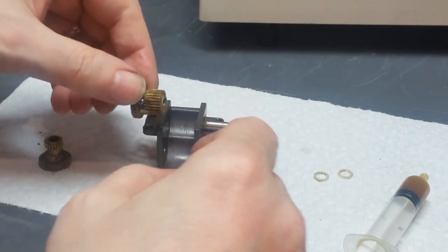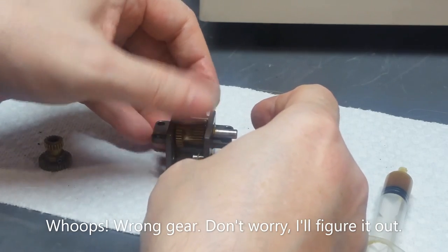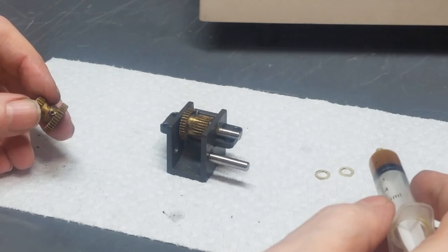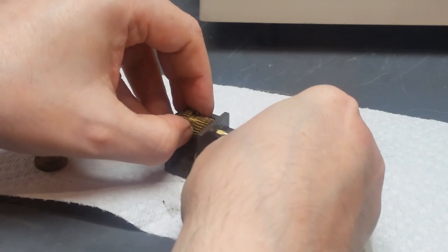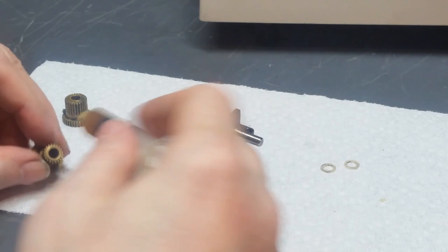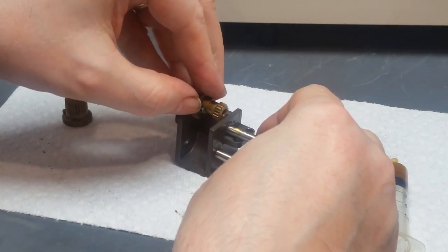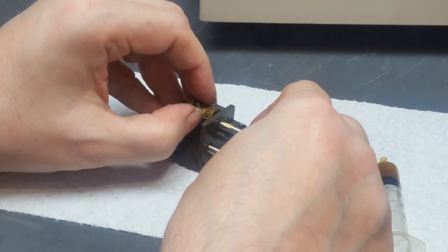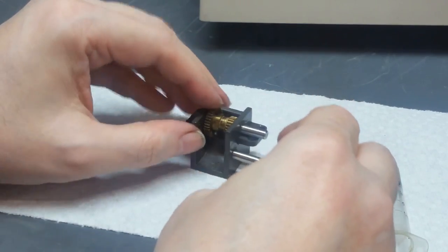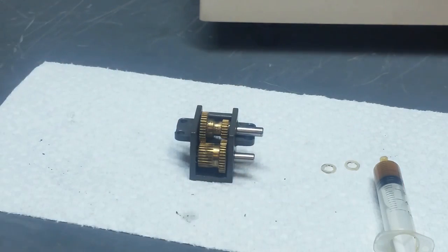Now what I'm going to do is drop it in place, push the shaft in to hold it. Okay, so right now that's not going anywhere. Now I'm going to repeat the same thing with the other gear, making sure I install it in the right direction. And I've already screwed it up. Told you it's important to put the gear in the right position, and then I proceeded to not do that. This one, let's put a little grease on both ends. Okay, this goes in the top. Like that. Okay, this one has already been greased. It goes in the bottom position, like that.